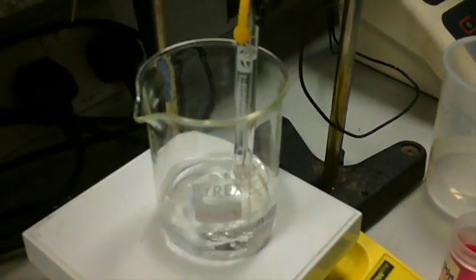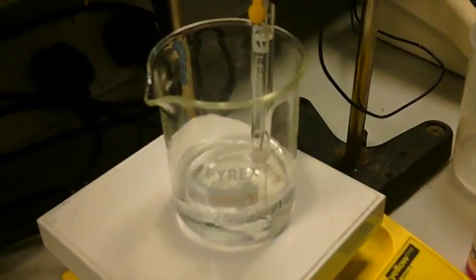Finally, you can check the pH of the solution before you store it in the fridge for next week.